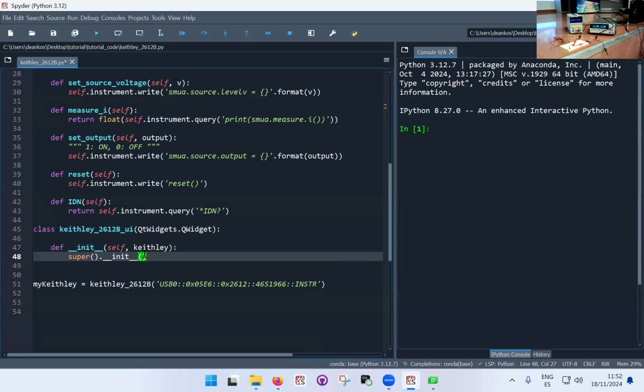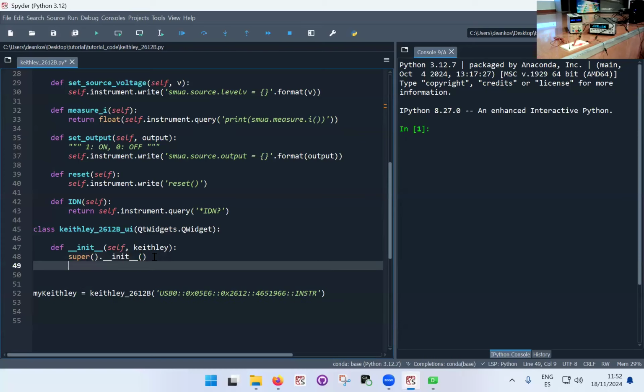In this particular case, I need to explicitly execute the initialization of the other class as well. And this is done through this super init function. If you're developing your own things, just put this line in whenever you're using Qt widgets, and things will work. It will give you an error if you don't. So I'm not going to delve into the details of what this actually is. I'm just going to put it in place.